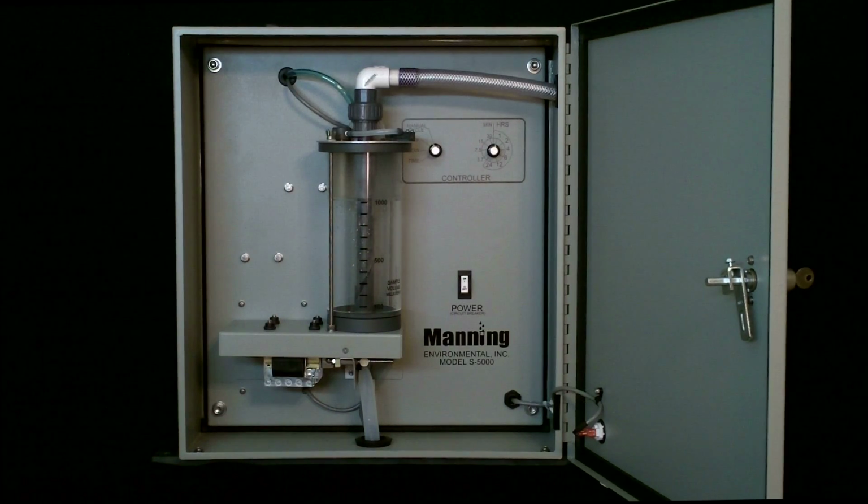The unit begins by purging. The unit then switches to draw. The sampler changes from draw to measure when the chamber is full. A pressure switch is what tells the unit that the chamber is full. The unit then deposits.